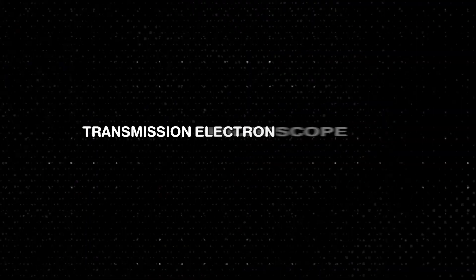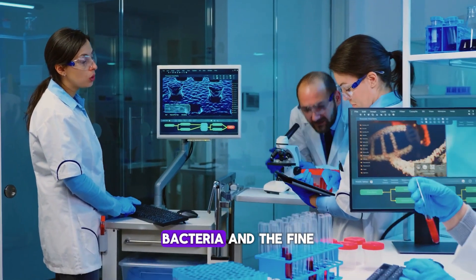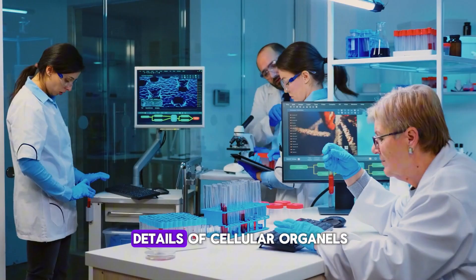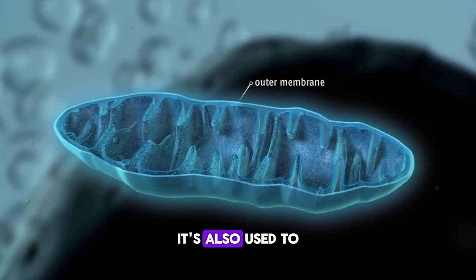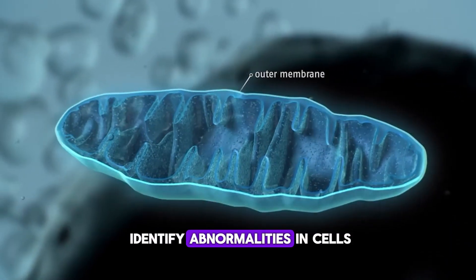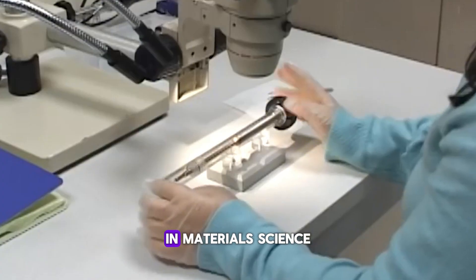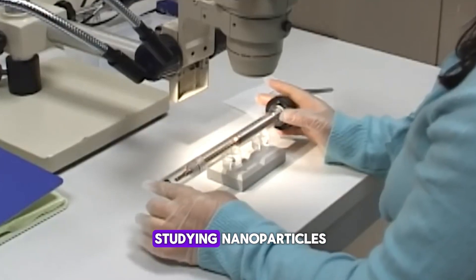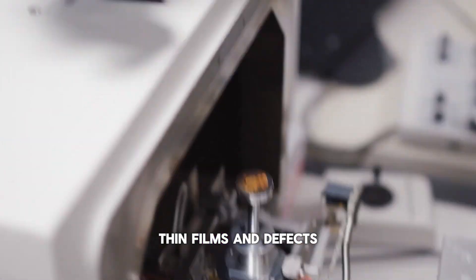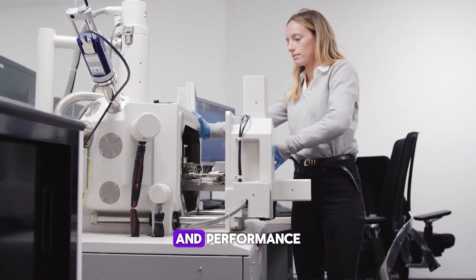Now let's look at the Transmission Electron Microscope in action. In medical research, TEM is essential for observing viruses, bacteria, and the fine details of cellular organelles like mitochondria or ribosomes. It's also used to identify abnormalities in cells and tissues, which helps in diagnosing diseases. In materials science, TEM is crucial for studying nanoparticles, thin films, and defects in materials, providing insights into their properties and performance.